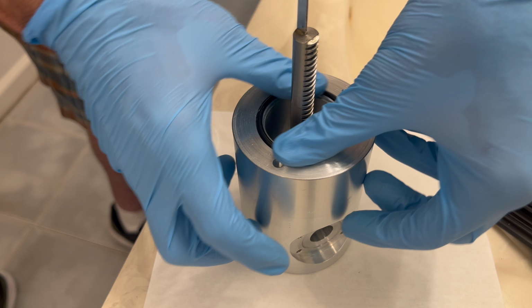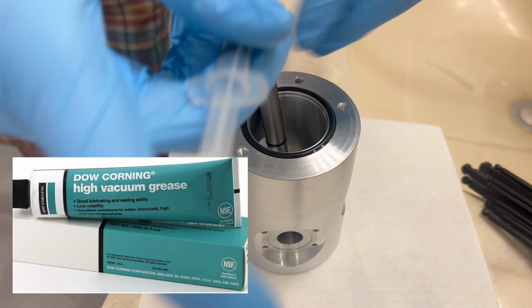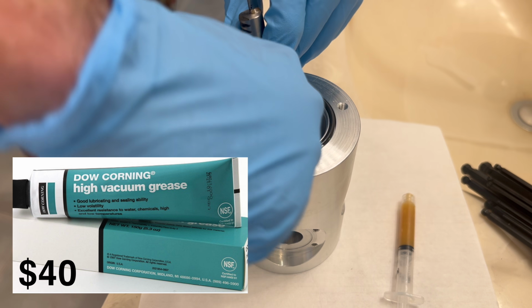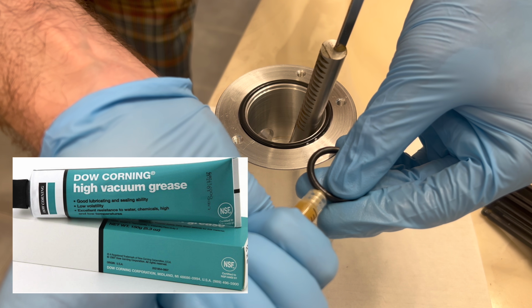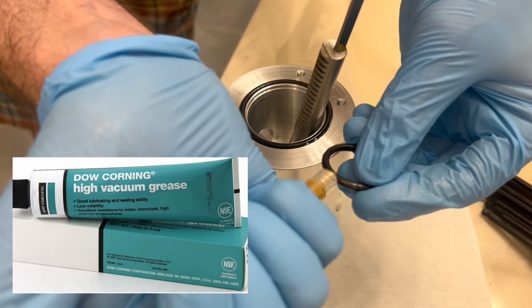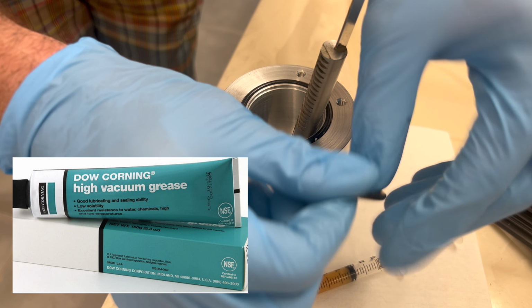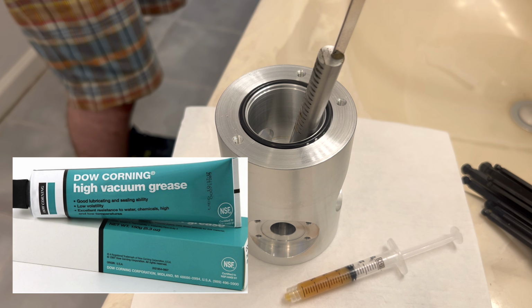Now, if you are in the know, you might be saying, what about Dow Corning high vacuum grease? This stuff is 10 times less expensive, only about $40 for a much larger amount. However, the problem is that this grease contains a bunch of silica, which is abrasive. It's great for static seals in a high vacuum system, but it is unsuitable for any moving parts because the abrasive silica would rapidly cause wear.